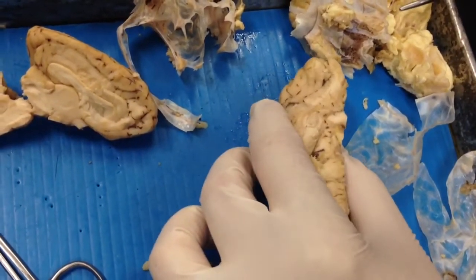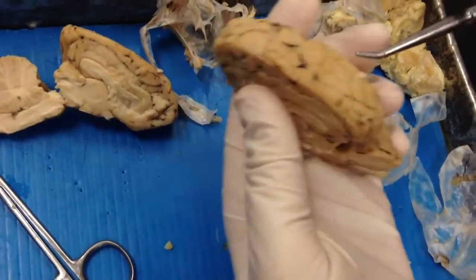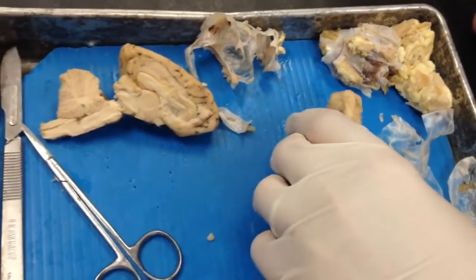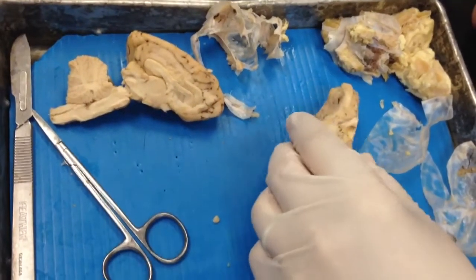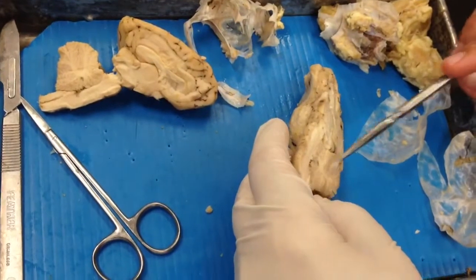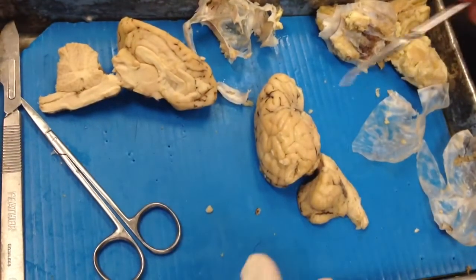Cerebral hemispheres — right and left. The cerebellum. And the cerebrum.